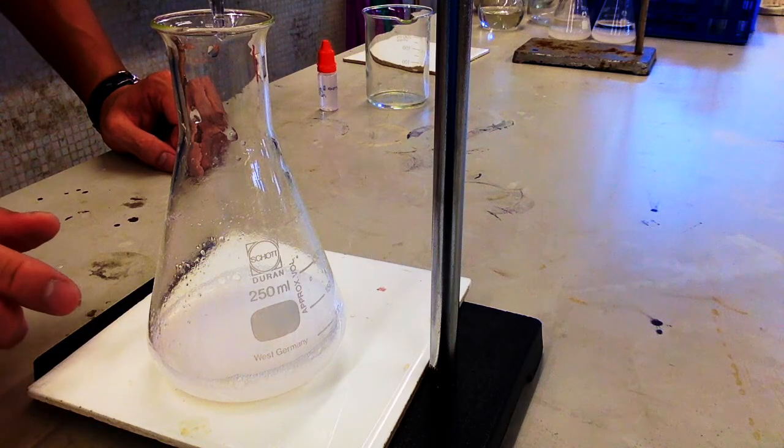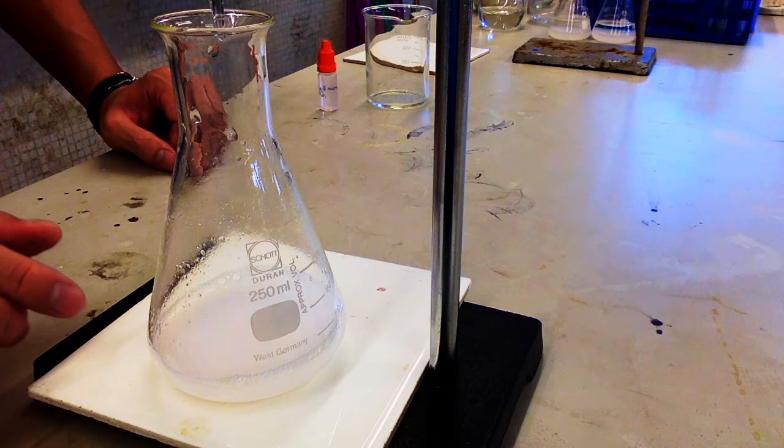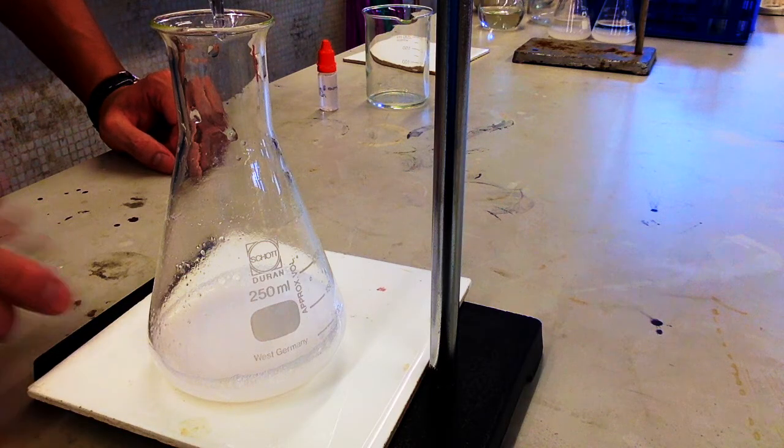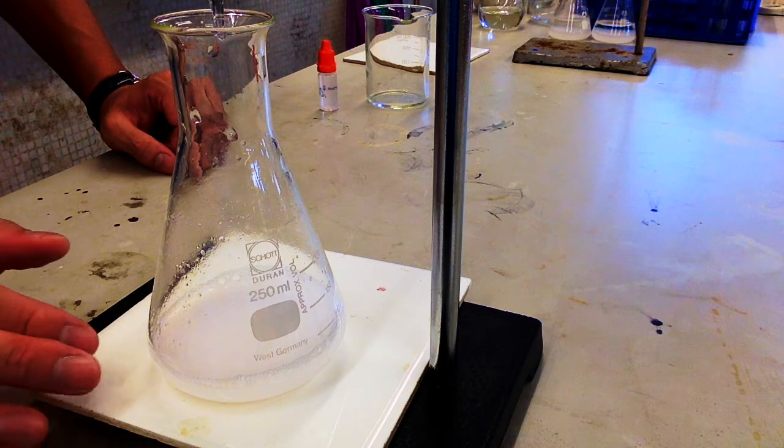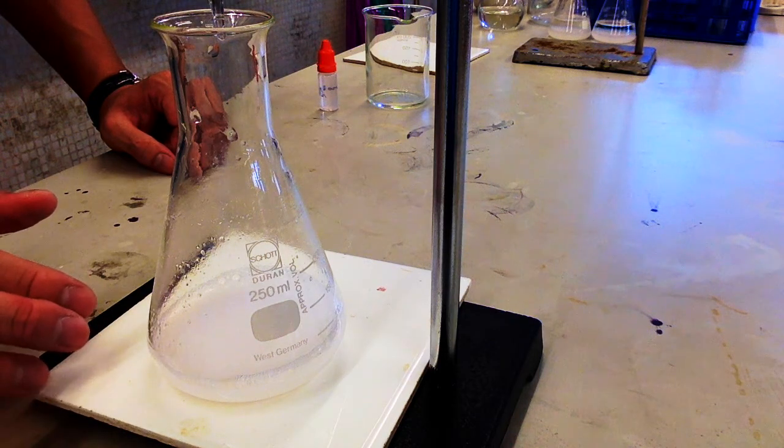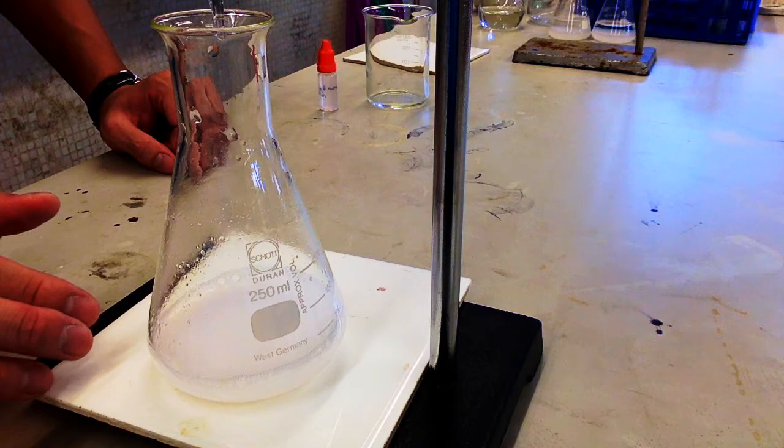Now, the endpoint has been reached, and it's quite hard to observe because of the cloudy suspension. But here, this faint pink color actually is the endpoint.